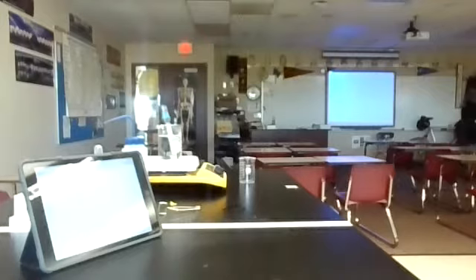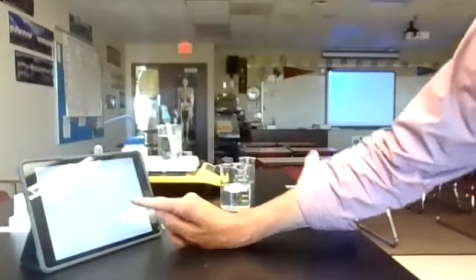I also have my ice water ready. We get 3 cubes of ice in there, and that should be cold enough to do the second part of this. It's almost all melted. There's still a little solid left, but when it's all liquid, we're going to see that temperature go up. That's what we're looking to see here.